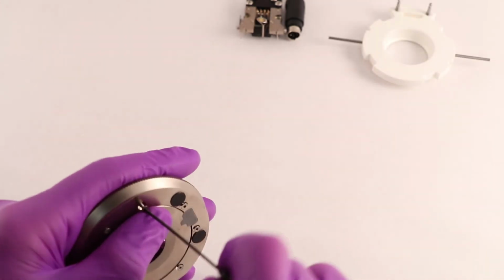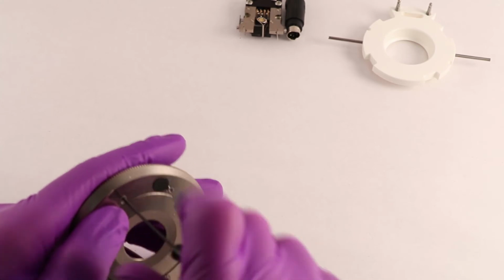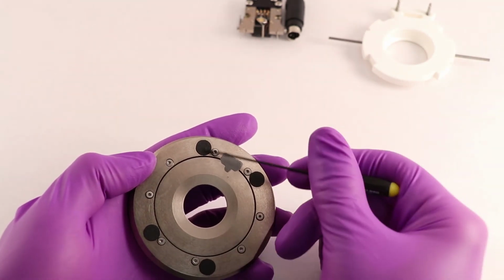Also make sure all screws are slightly loose to allow for alignment of the dovetail and the chamber base. Tighten the screws in a crisscross pattern and final check all screws. The screws have to be snug, but do not over tighten or strip.